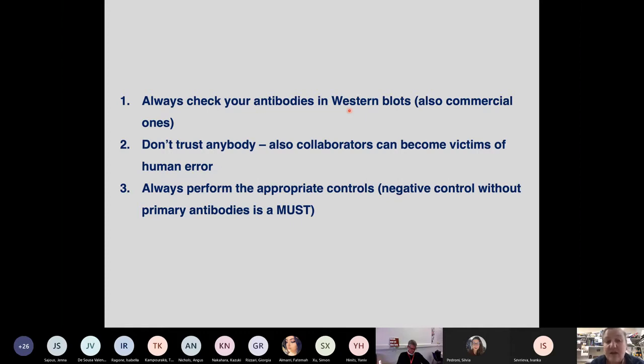And the third essential is that you always have to perform the appropriate control. Whenever you do your stainings, you have to have a negative control without primary antibodies, because the secondary antibodies, which is what you will be seeing in your fluorescence microscope, may show all kinds of stuff. Last week, I was contacted by somebody who said, in our cardiomyopathy mice, we have this relocation of our favorite protein to the plasma membrane, and can we show you the pictures? And I looked at the pictures and said, well, that's just the background from the secondary antibody. Your primary is a mouse monoclonal, and you have cardiomyopathy mice with fibrosis, so the anti-mouse secondary just shows this plasma membrane associated background. It was most likely not exciting biology, but just an artifact.